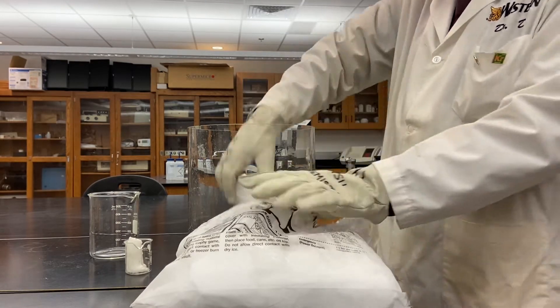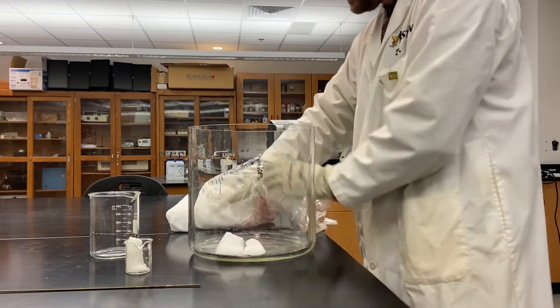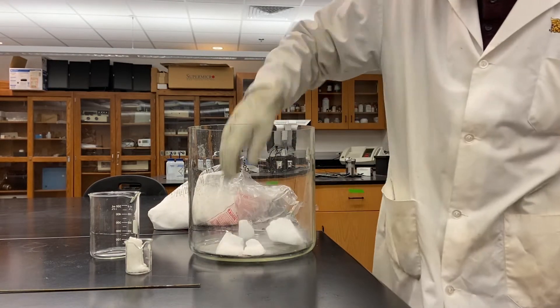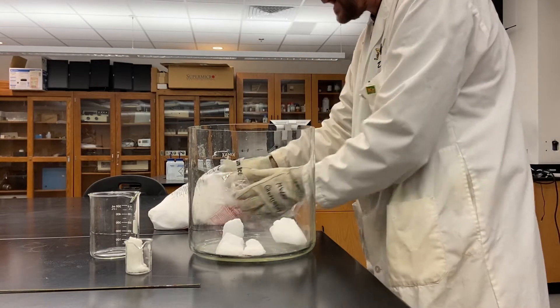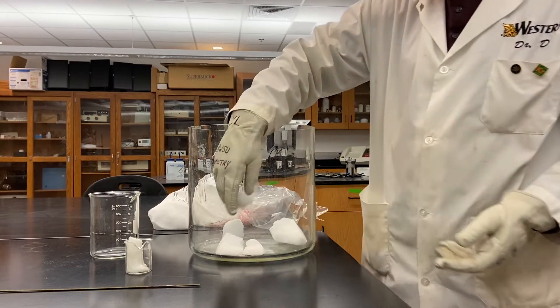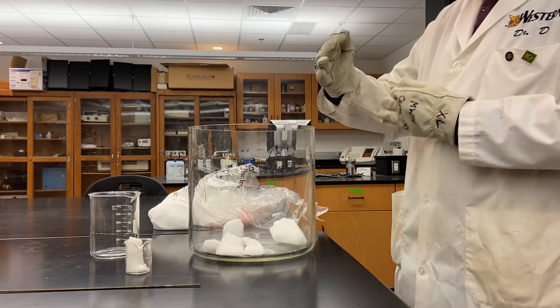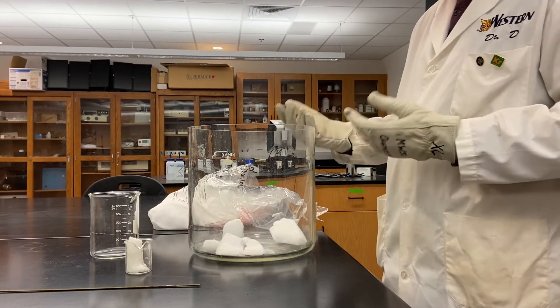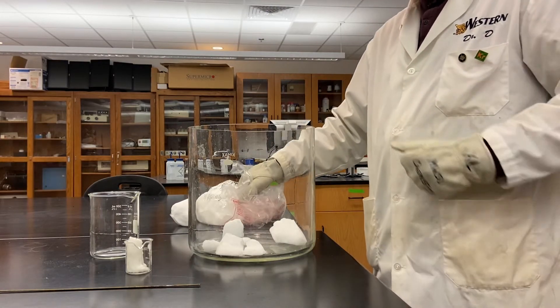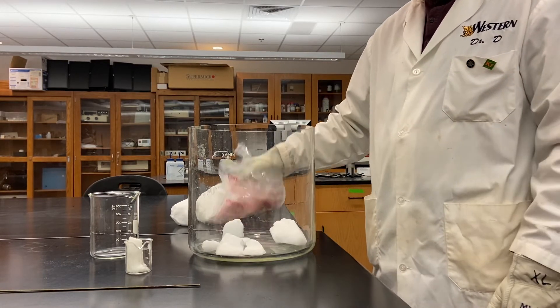What I'm going to do with my dry ice is place some smaller pieces into this container, because we want the dry ice to go from the solid phase into the gas phase. Dry ice will do something called sublimation — that means there's no liquid intermediate when it evaporates, or more correctly sublimes. Right now what's happening is I'm filling this container with gas phase carbon dioxide.